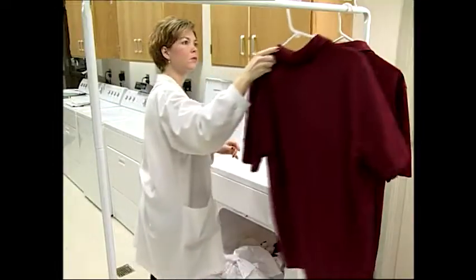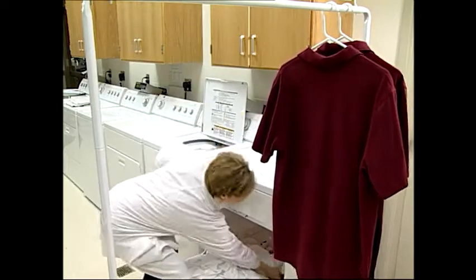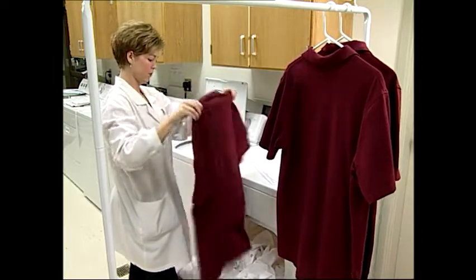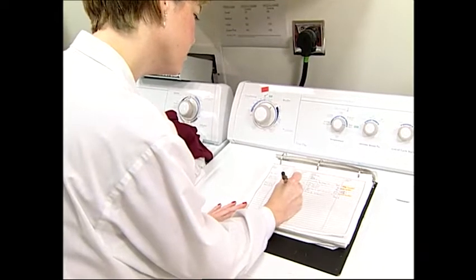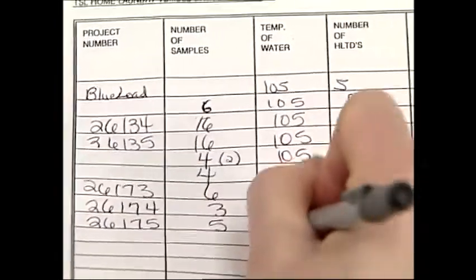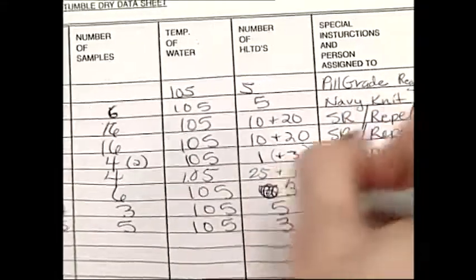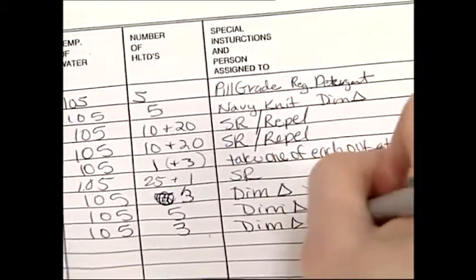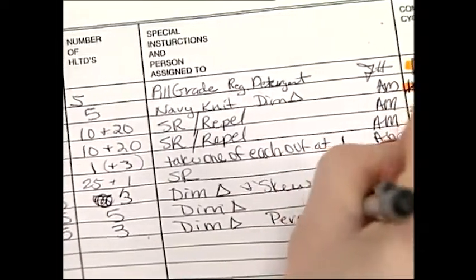The washing and drying machines in the testing step don't have to be located in a standard conditions laboratory due to the heat and humidity generated in laundering. Each sample's identification should be logged into a logbook in the laundry. The information should include the ID number, the number of specimens, washing and drying conditions, the cycle instructions, the type of detergent to be used, and any special instructions.